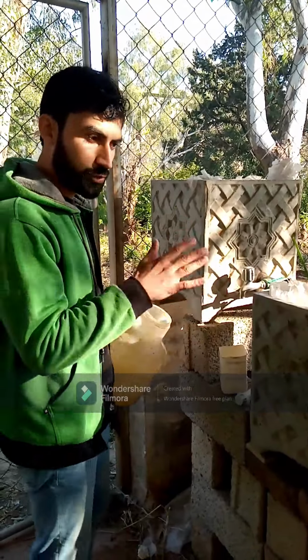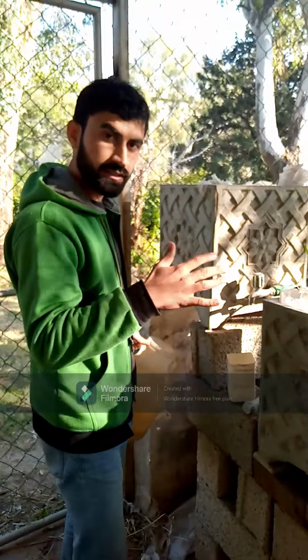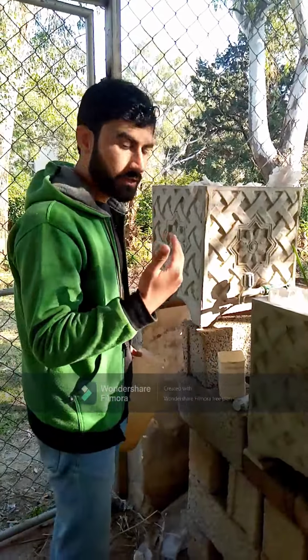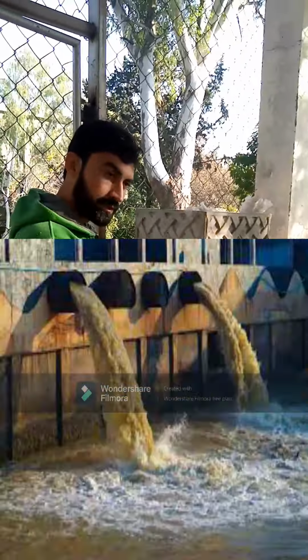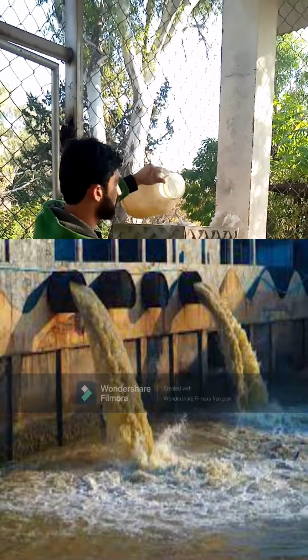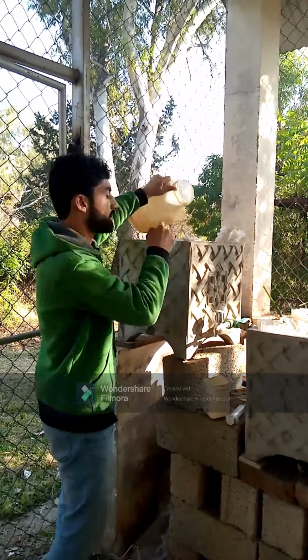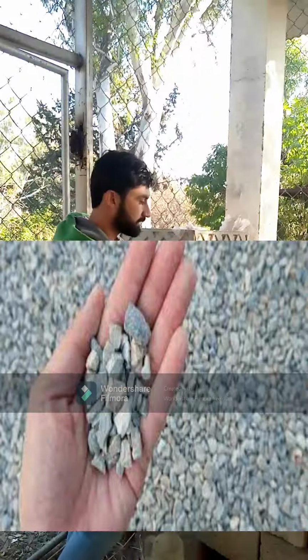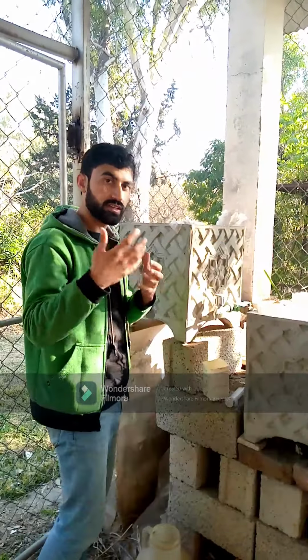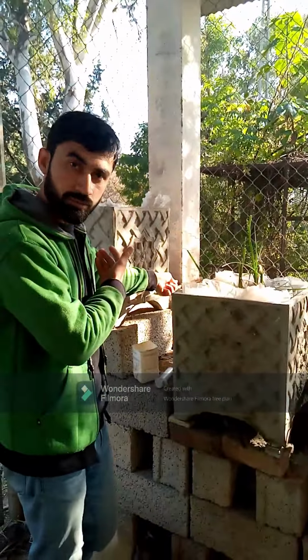Guys, this is Wetland technology, and I'm doing experiments on horizontal subsurface flow constructed wetland. So how it works: we put the industrial wastewater sample here in the first strip. This strip has gravels. We filled this strip with gravels, and the large particulates are trapped in the gravels, and it's a physical removal mechanism.